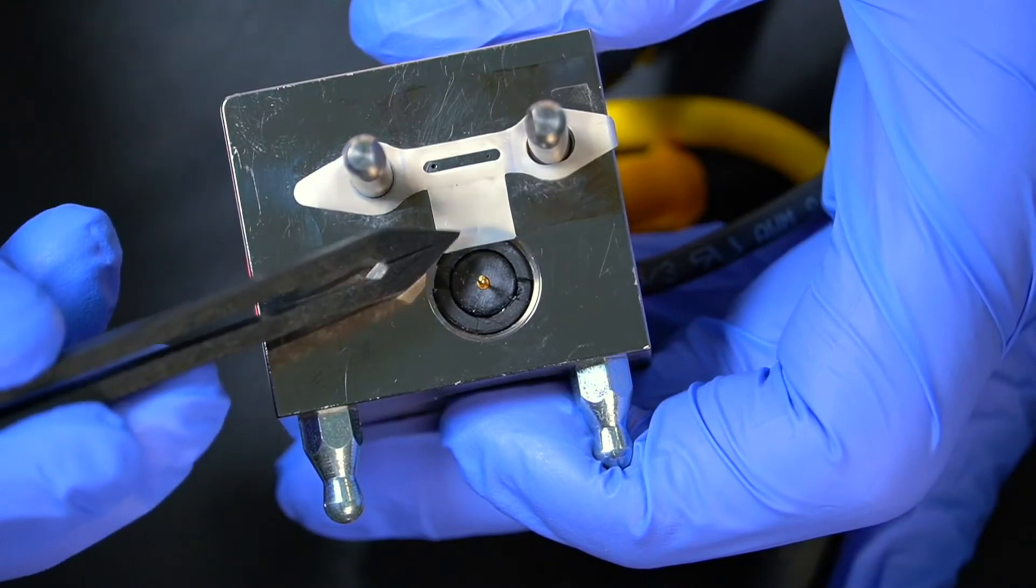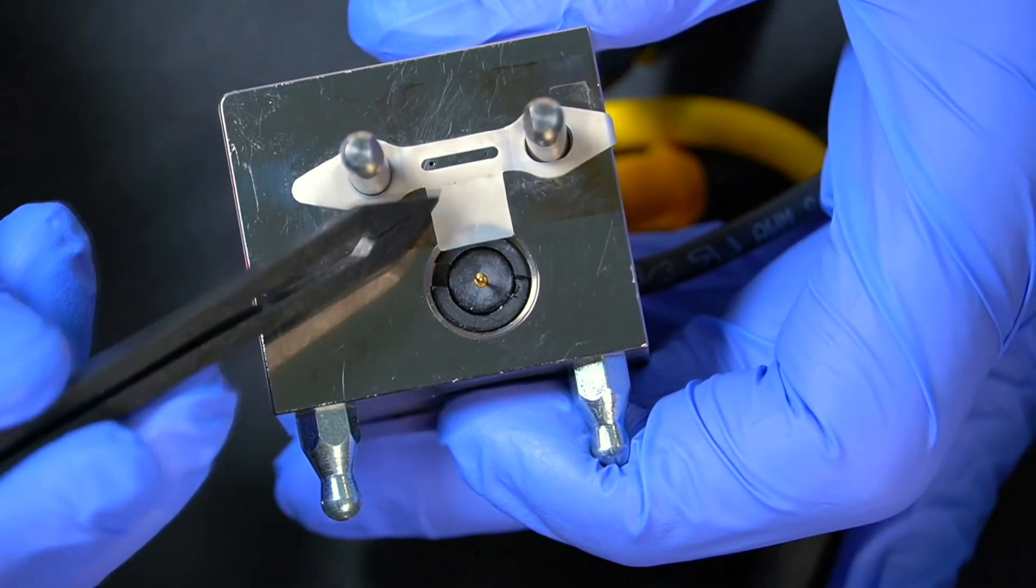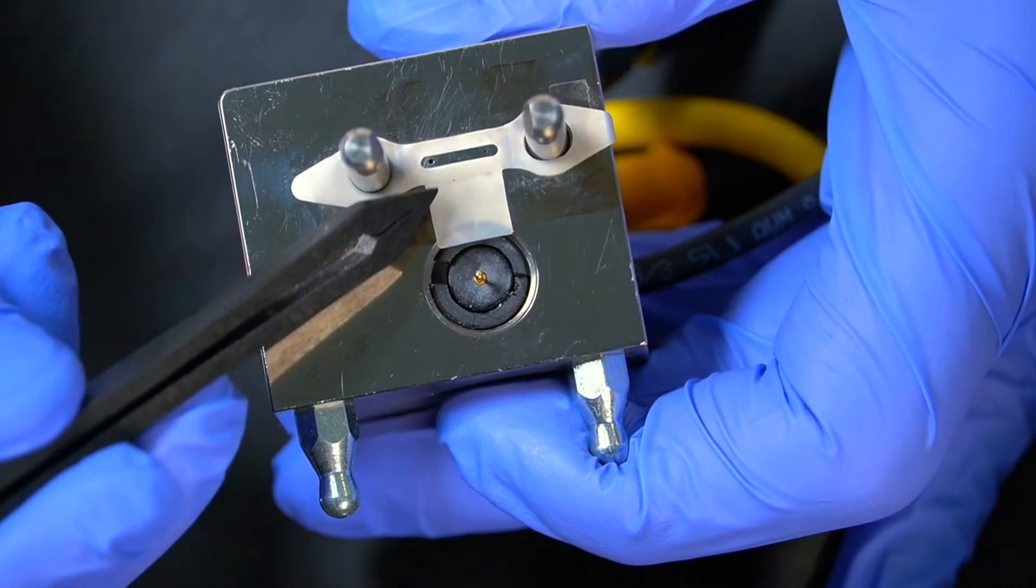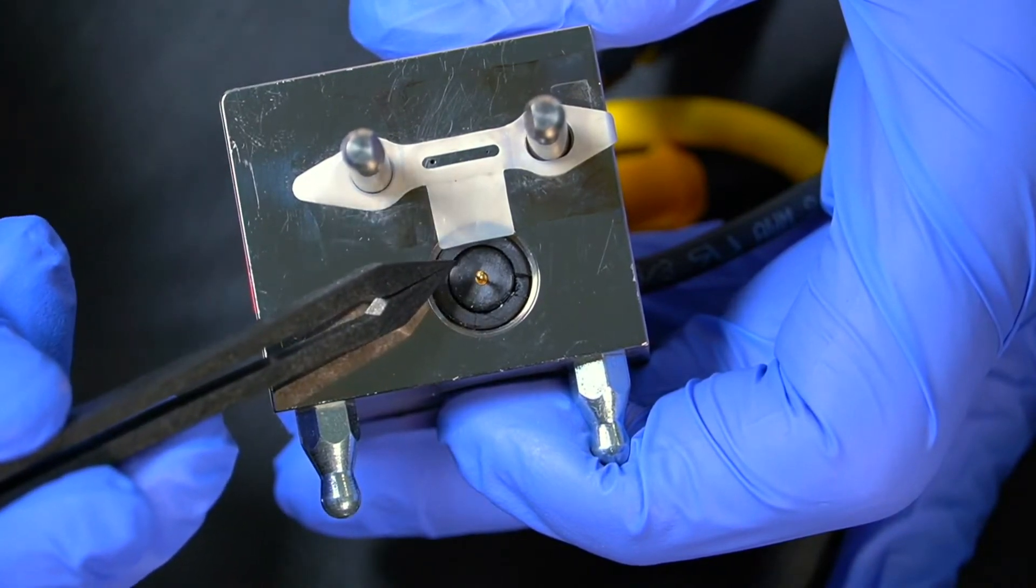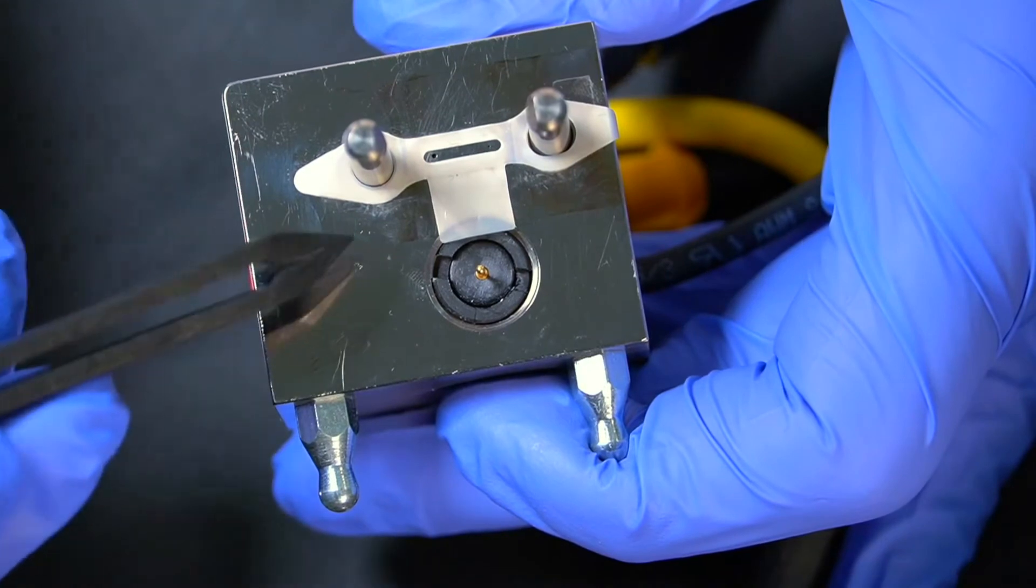It's important that this tag is in this orientation so it forms an insulator between where the electrode surfaces and the little pin where it connects into the power supply. By the way, you might see on here there's some slight discoloration on the surface of the cell.